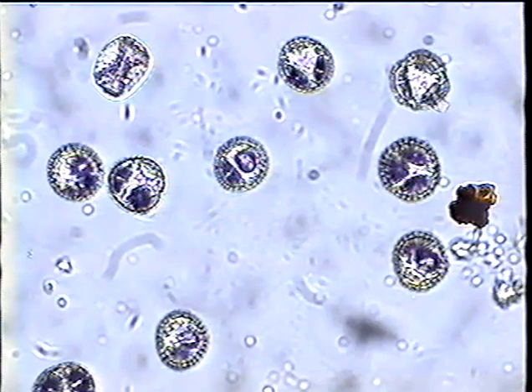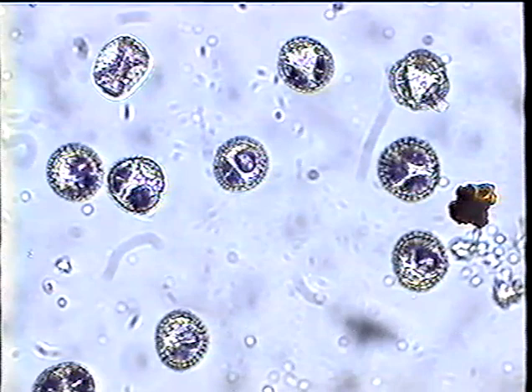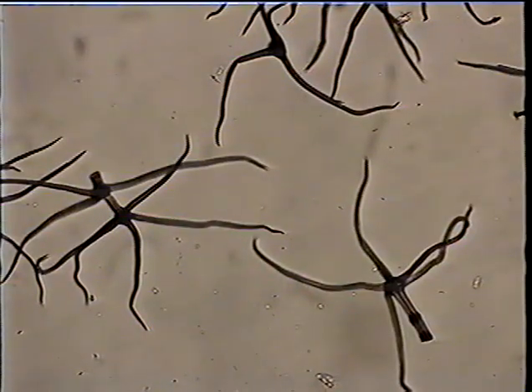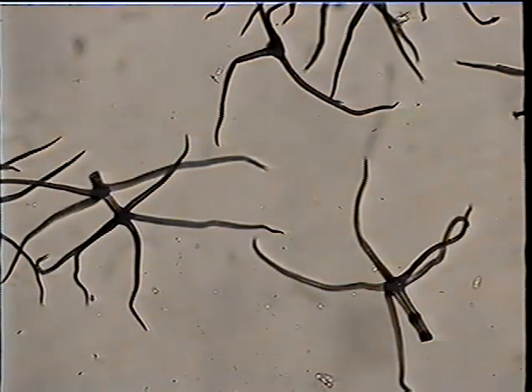This is ragweed pollen. Ragweed pollen is obviously different in shape. I call it the bottle cap pollen to help me recognize and remember it. We'll just see a couple of these pollens before we switch to leaf hairs. These are hairs that grow on the underside of leaves and grasses, and they are distinctive with respect to the species of the tree or the plant on which they grow. They're called stellate hairs, and these come from the sycamore tree.